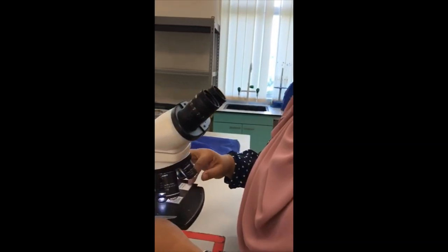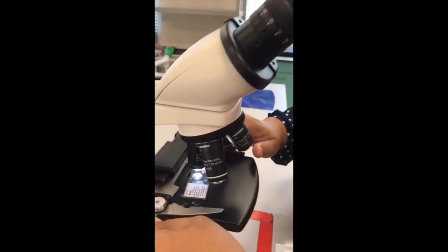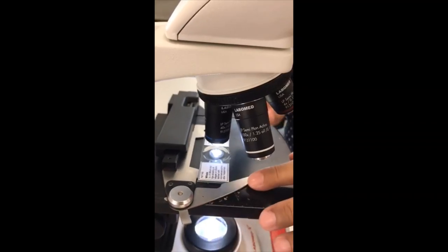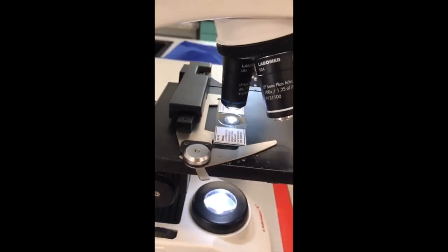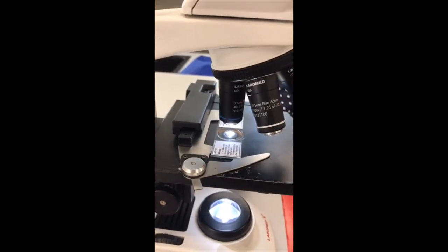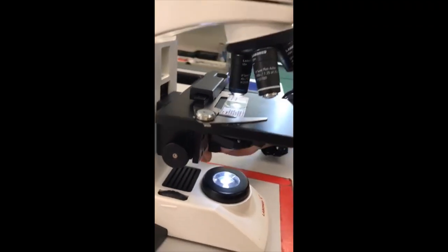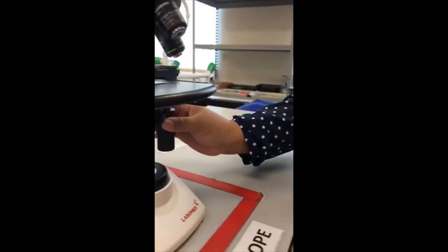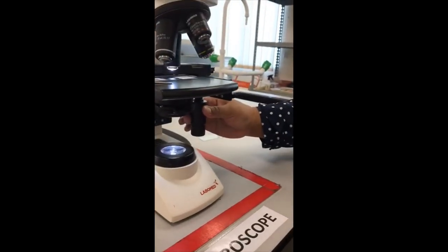My specimen for today is Allium root. I want to see the stages of mitosis. I will place it on the mechanical stage — there's a clip there — and using the knob below the mechanical stage I can move the stage left, right, forward, or back.